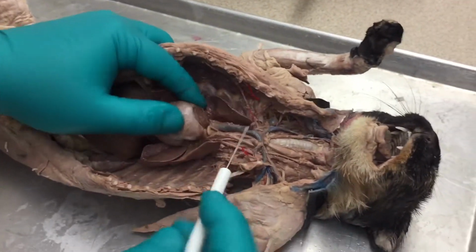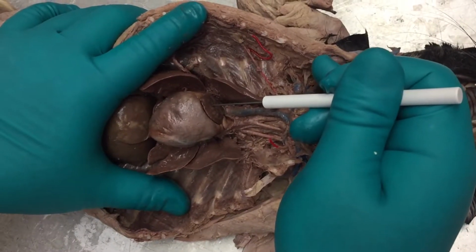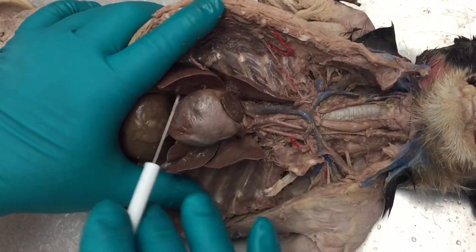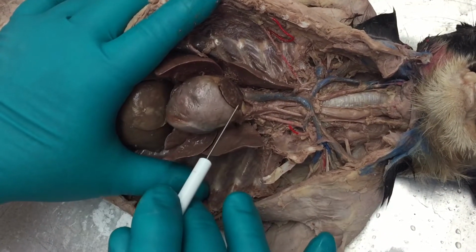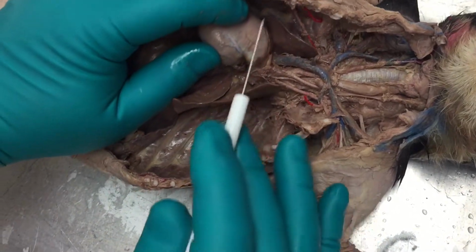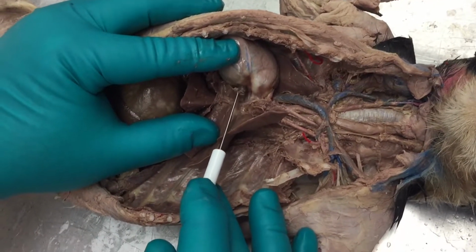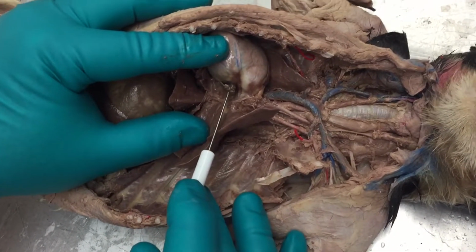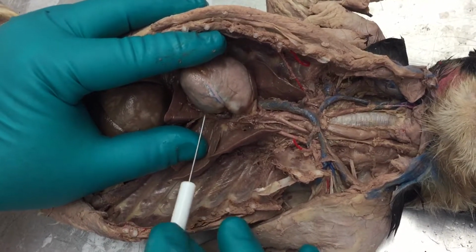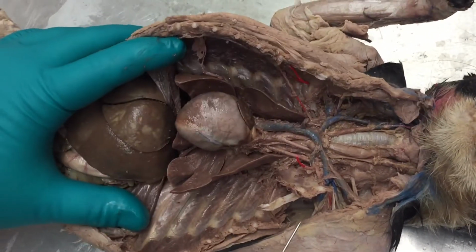Now, the chambers of the heart. On the top of the heart, on the right side, would be the right atrium, which goes down to the right ventricle, which is here, and that would go through the tricuspid valve. Then that would go to the lungs. It would come back to the left atrium, which is this little small chamber right here, and from the left atrium it will go to the left ventricle through the bicuspid valve. Then it goes out through the aortic semilunar to the aorta.